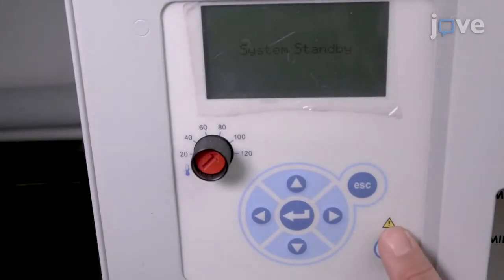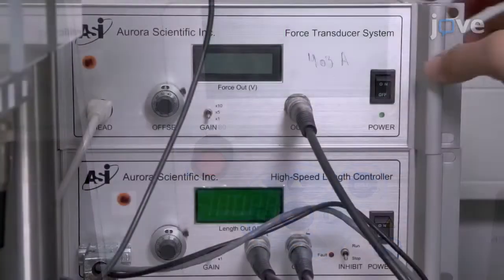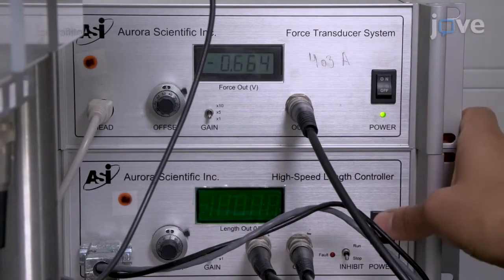Before beginning the procedure, adjust the temperature of the testing apparatus in-chamber to 15 degrees Celsius and turn on the force transducer and the motor.